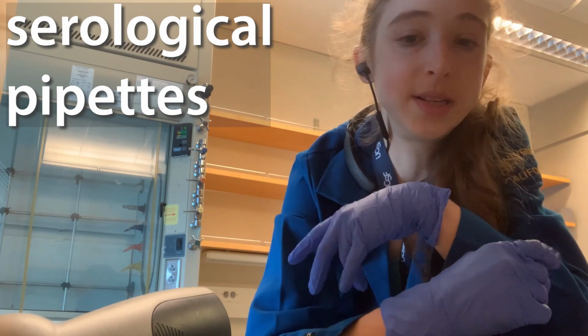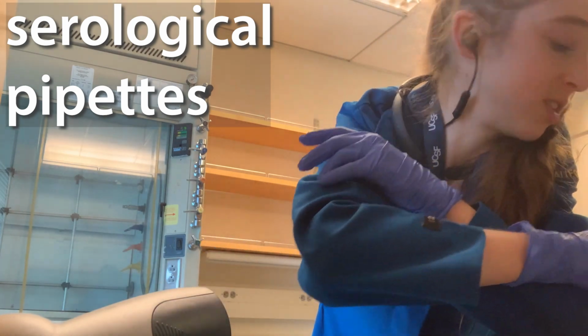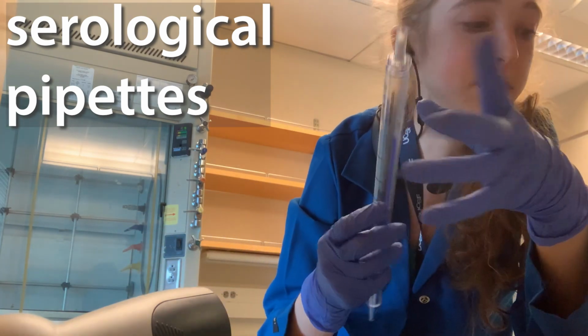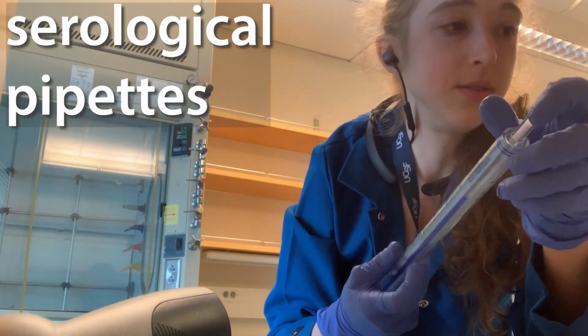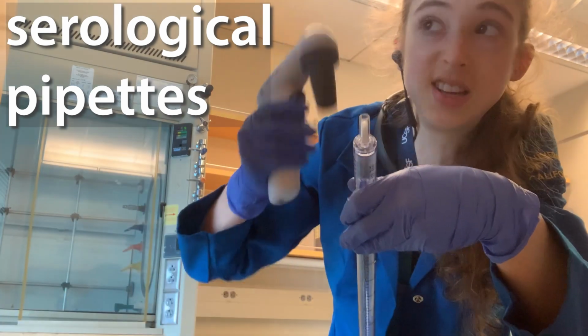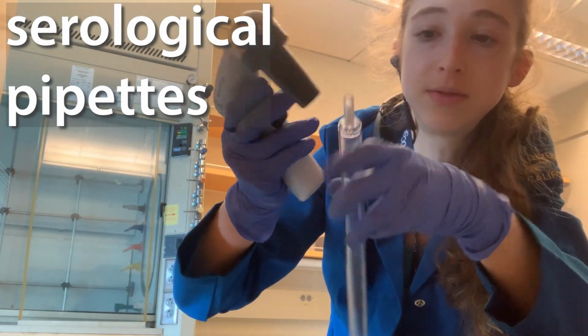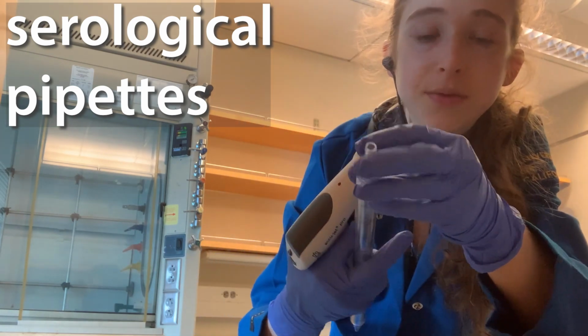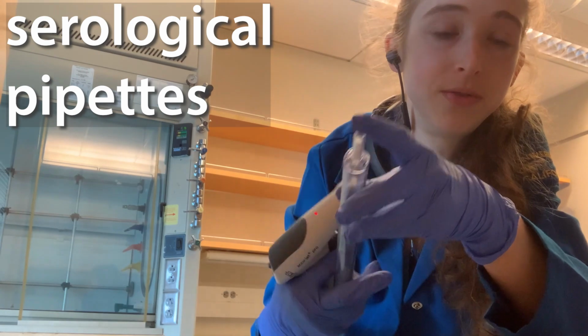Okay, those are the basic things about pipettes. As I talked about in yesterday's post, you also have this idea of filter tips. You also see filters in these serological pipettes, especially because when you're sucking up, if you suck up too far, it could get in here and damage this. So there's a filter here to make sure that you're not sucking up too far.